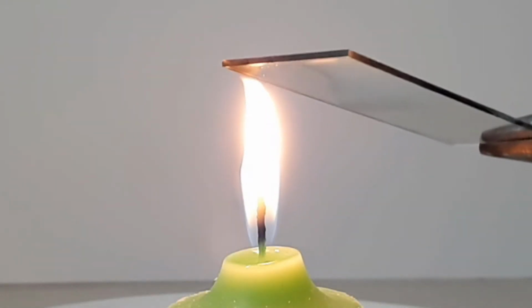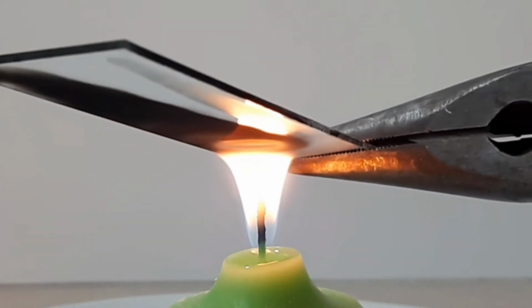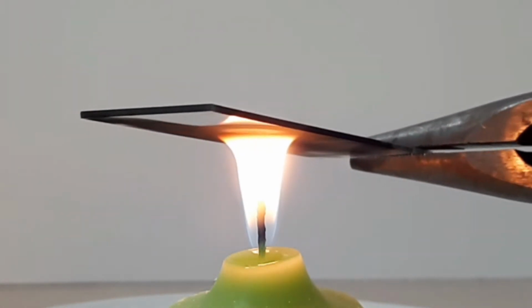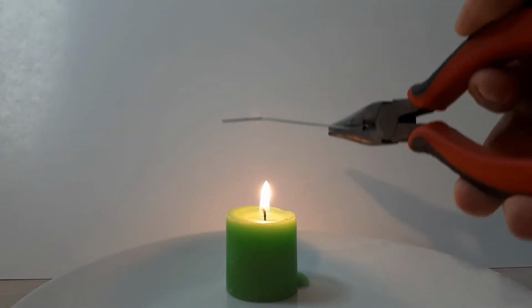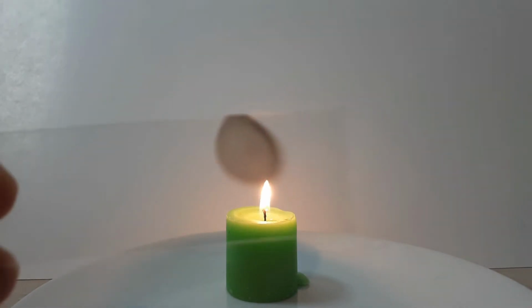In this demo, when we place a substrate in the path of the flame, oxygen is limited where the flame and the substrate meet, resulting in incomplete combustion, which produces carbon that is deposited onto the substrate. Interestingly, if we were to dissect the candle flame, we would be able to see that the flame itself is hollow, and that only the outermost region of the flame is supplied with enough oxygen to sustain combustion. We can also see this by quickly introducing and removing the substrate, where we find the carbon is deposited in a ring.